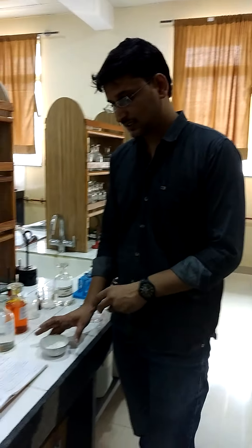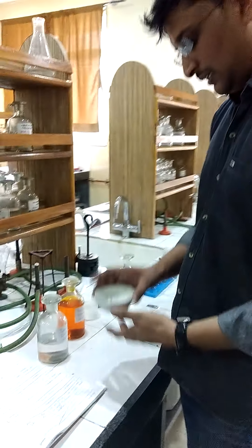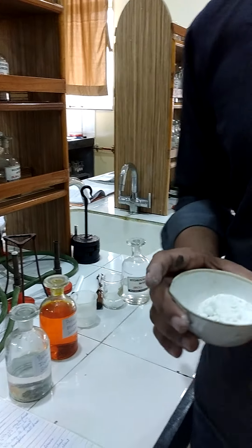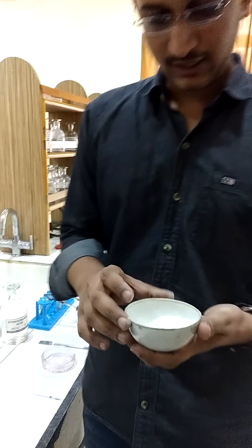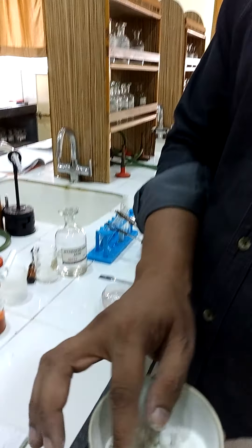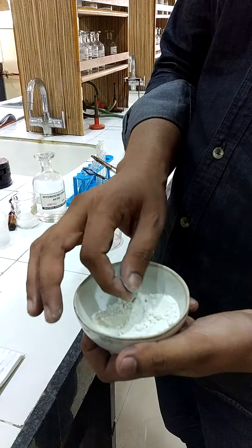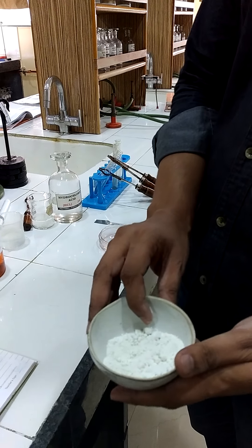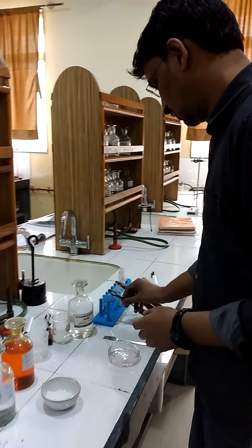As we have seen in the explanation, now we are going to take a salt. We have taken a salt first, and we are going to do the preliminary test. In the preliminary test we are going to see the nature of the salt. This salt is amorphous. The color is white and it is visible. Now we are going to test it for solubility.